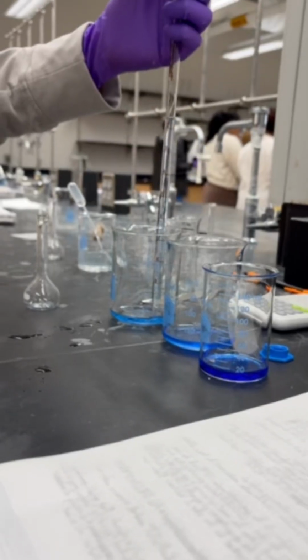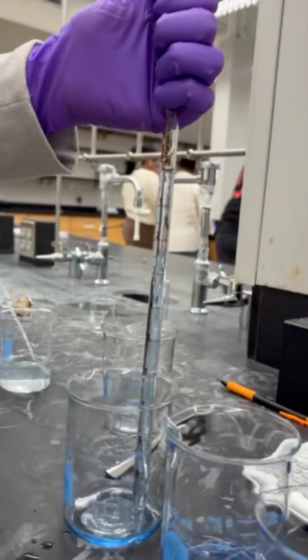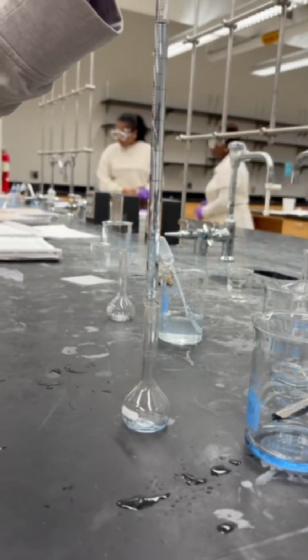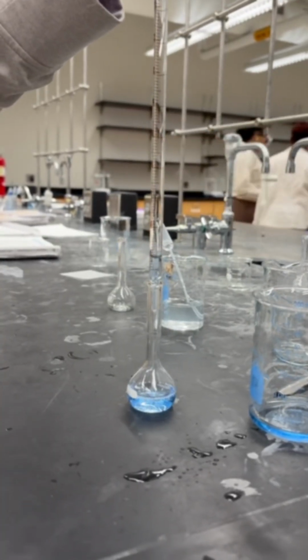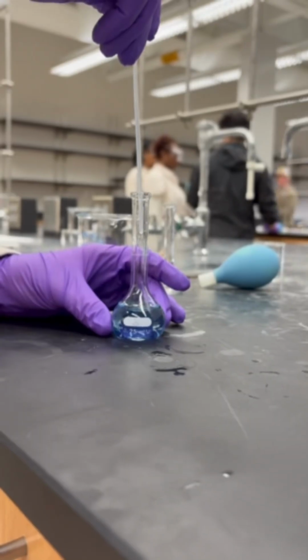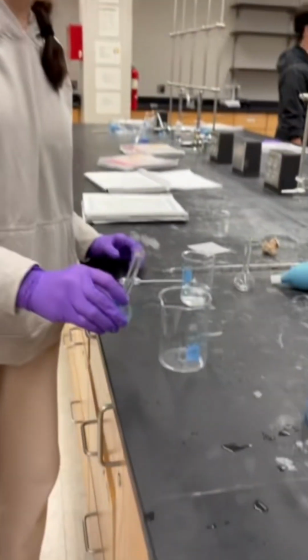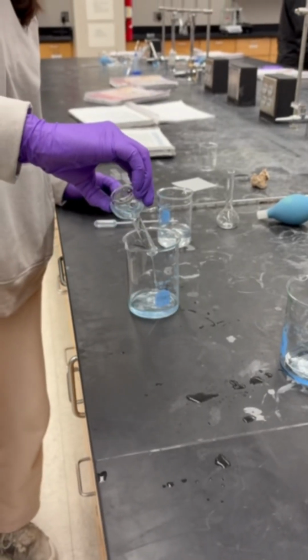We then begin our third dilution. Now, the reason why we are making three dilutions is more important to the second half of this experiment, which will not be shown in this video. But we will be sending these solutions through a spectrophotometer, which will read the absorbance of light through these liquids. Now, the absorbance is directly proportional to the concentration of your dilution.